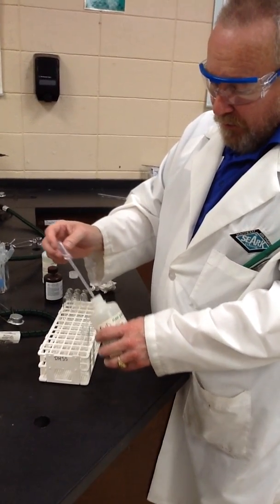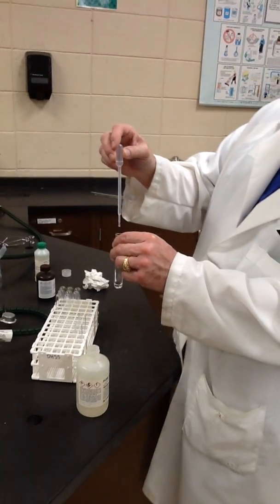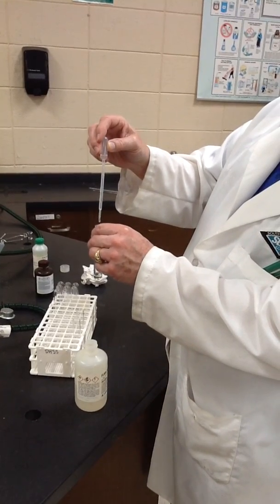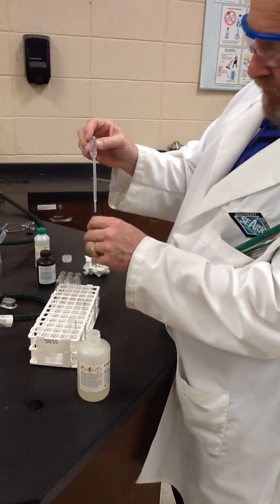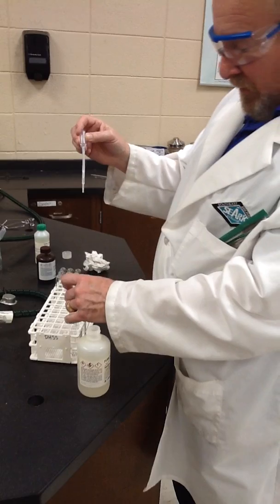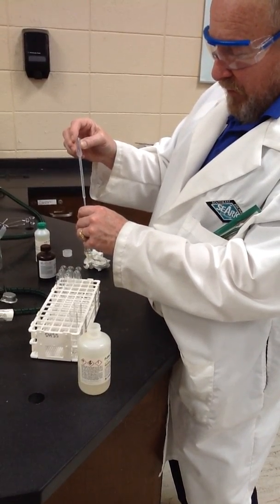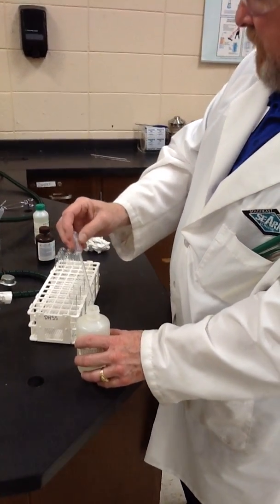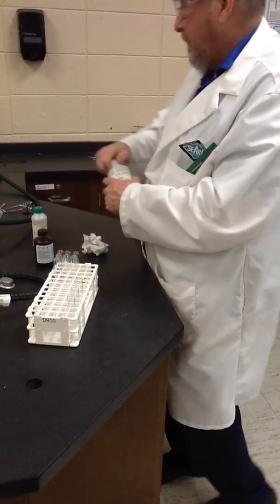10 drops, we really don't need to work in a fume hood, but if you're using large quantities you would. It has a high vapor pressure, you can see it evaporating and pushing the drops out. So now we have, like oil on water, a layer of hexane floating on top of our solutions of ions.